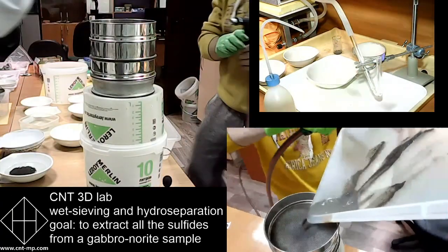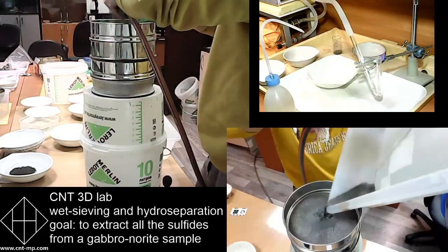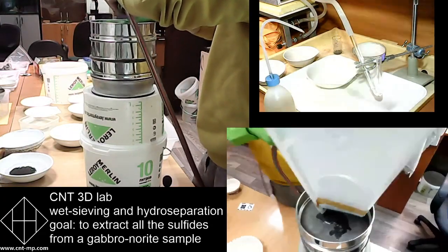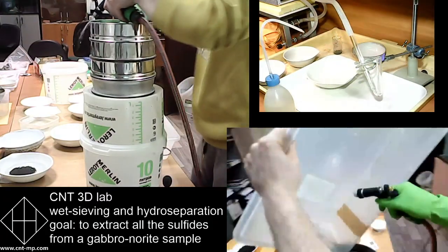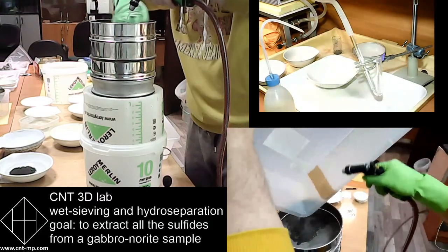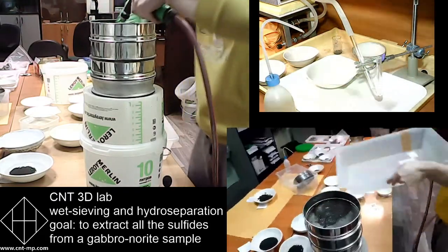So it's all minus 1 mm, goes now below 0.5 mm. The coarser sieve size is 0.5 mm, and everything is now being passed through 0.5, the whole amount of sample.